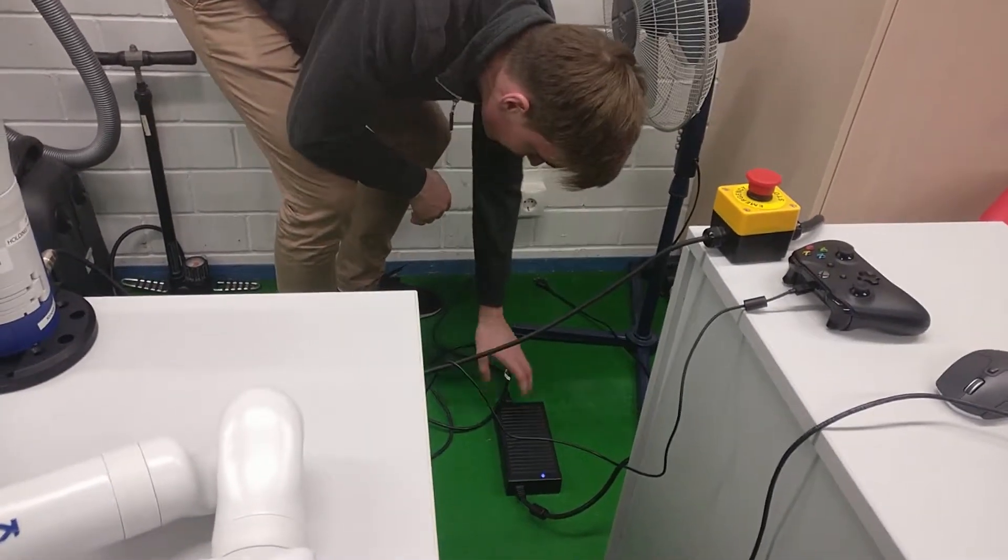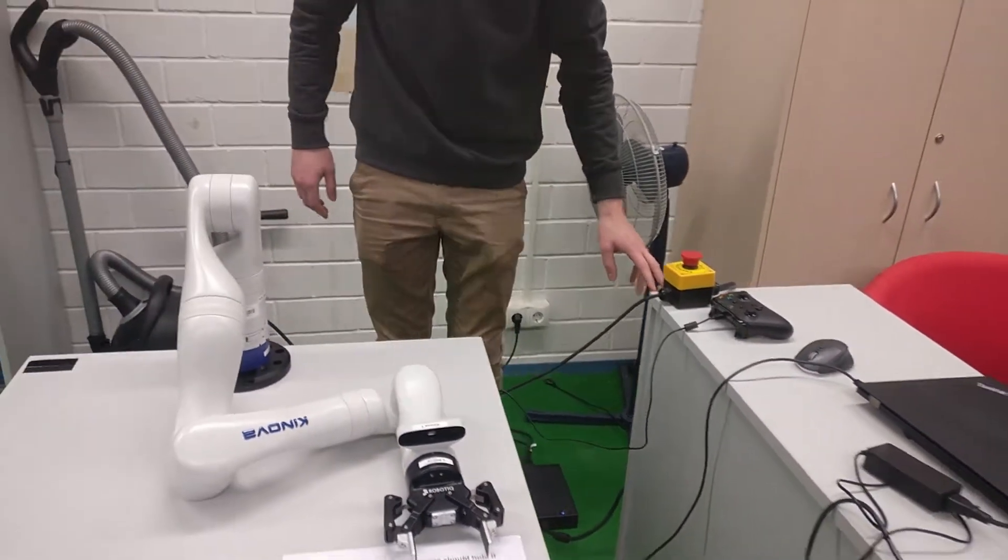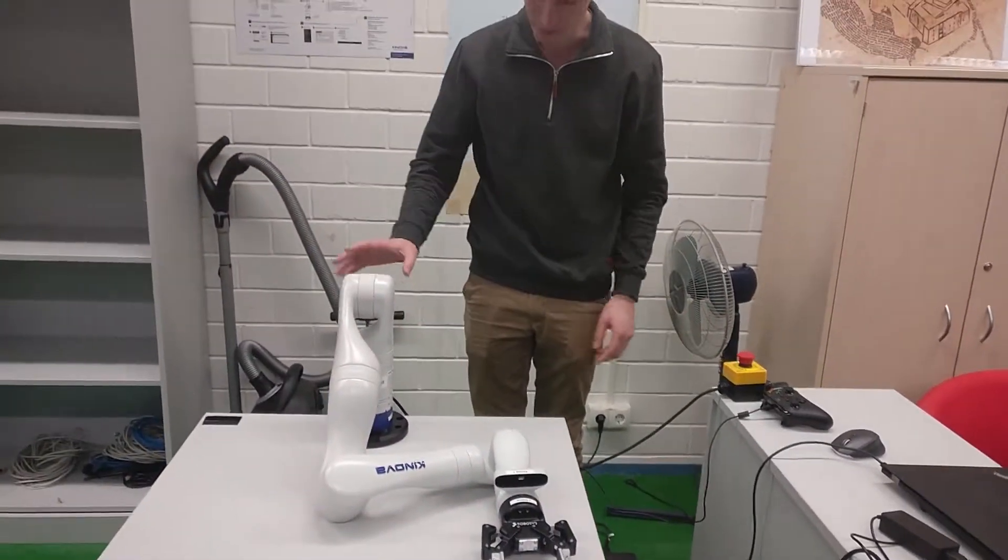The AC power runs through this into the power brick and from the power brick through the emergency stop button. The DC current runs through to the robotic arm.